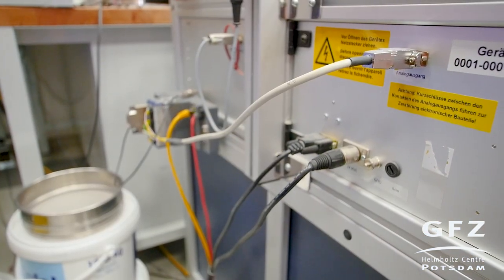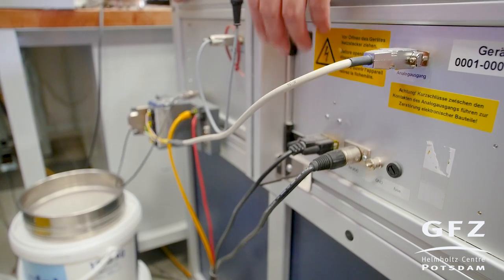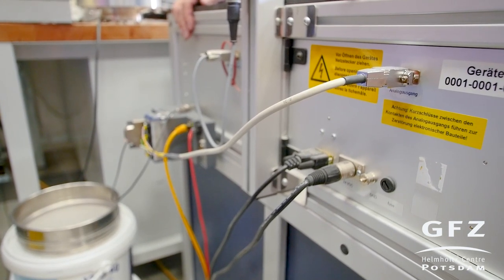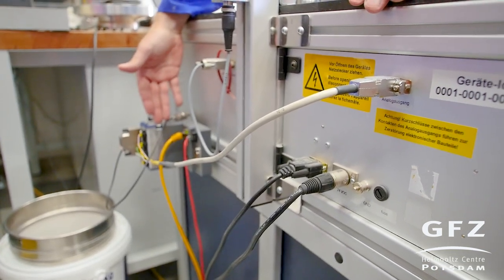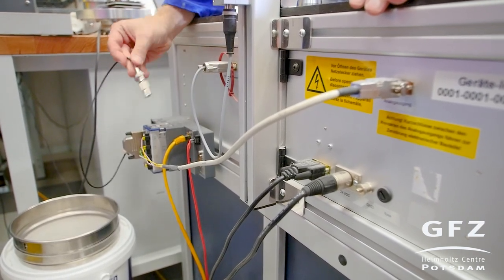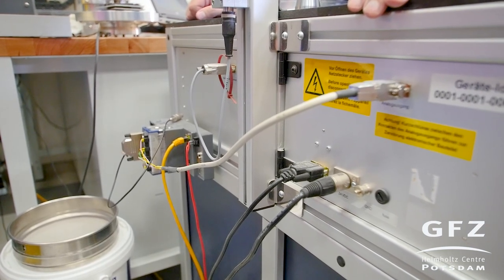At the back of the machine we can see all the digital inputs and outputs. To control the machine we have a COM port which is used by the software RST Control to drive the machine itself. On top of that we have an analog output which we measure using the CompactRIO to get data at high frequency over four channels. Additionally we have a trigger output that we can use to trigger our cameras for some experiments if needed.